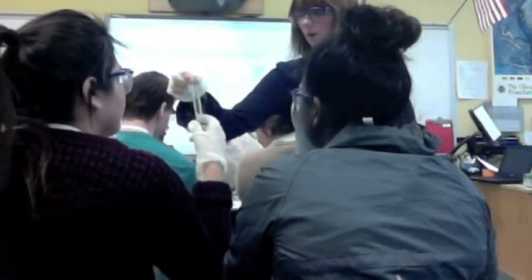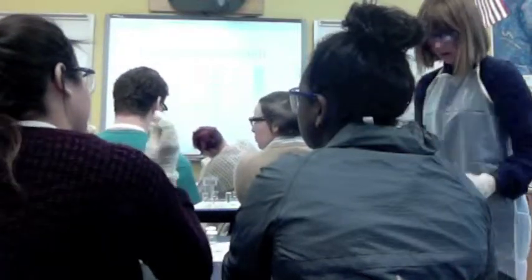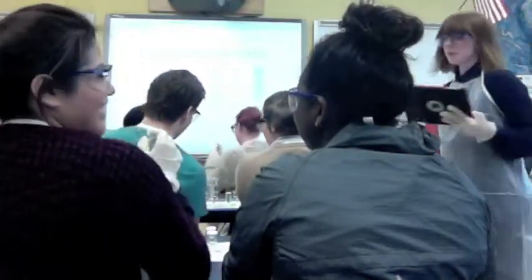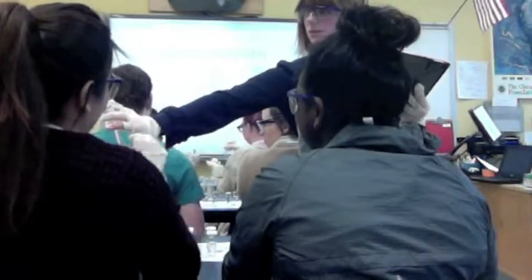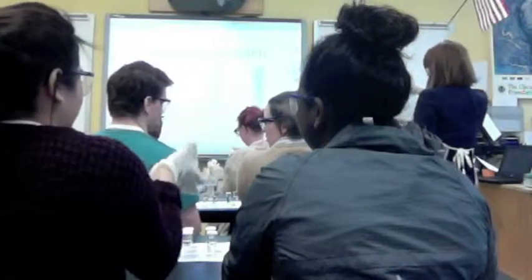Yes, I'll show you. You may begin shaking it back and forth. Do we have to shake it? You can go like this, up and down, and you're going to keep doing that until I tell you to stop. Can I shake it myself? You're going to shake it back and forth like this.